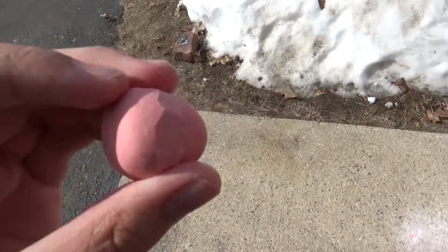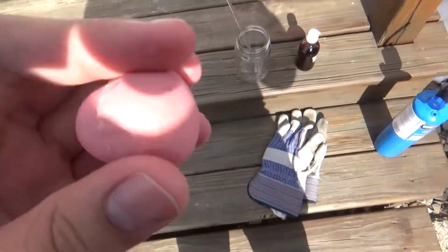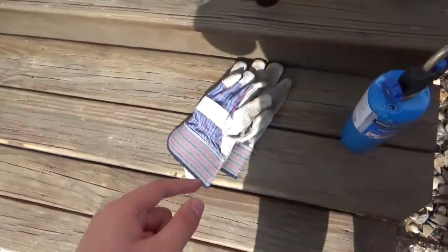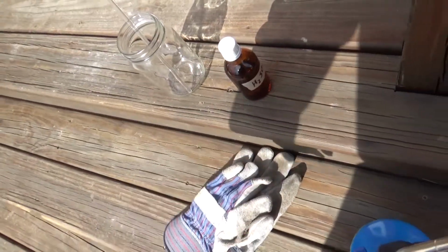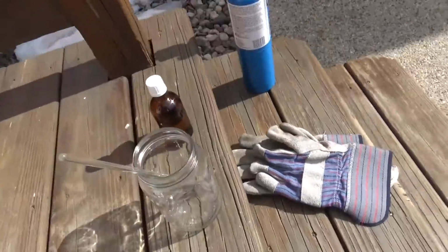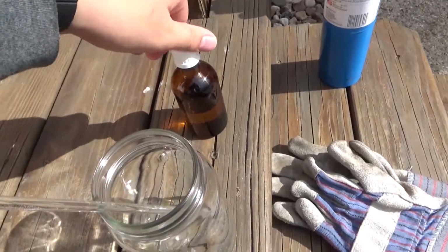Alright, here is my piece of Proto Putty that I made. I'm expecting it to be actually fairly chemically resistant, but I guess we'll just have to see. So over here, I've got concentrated sulfuric acid, well over 95%. If I had to make an educated guess, I'd say closer to 97 to 98. But yep, there's sulfuric acid.